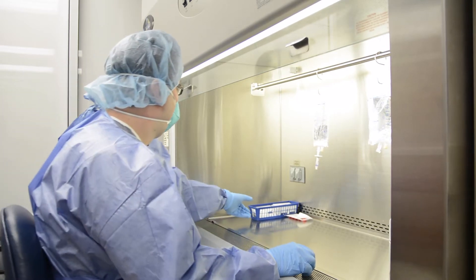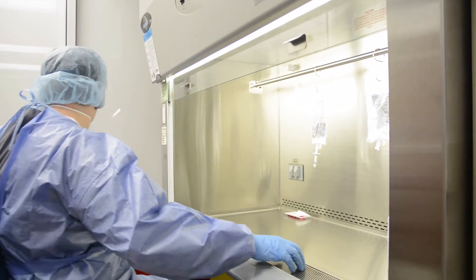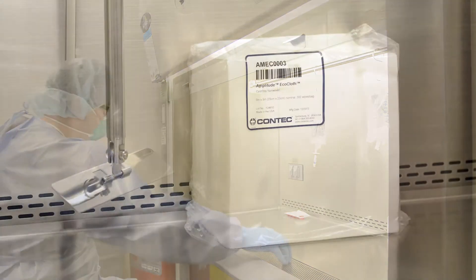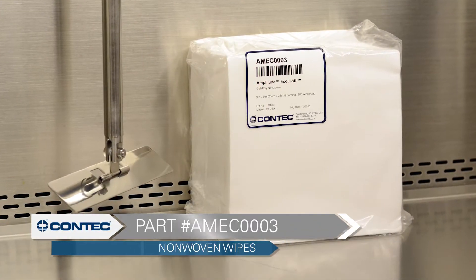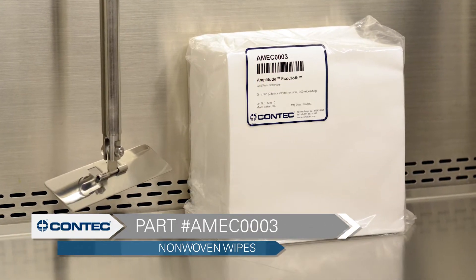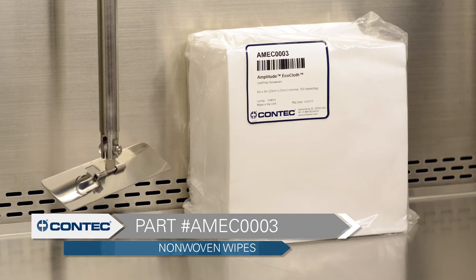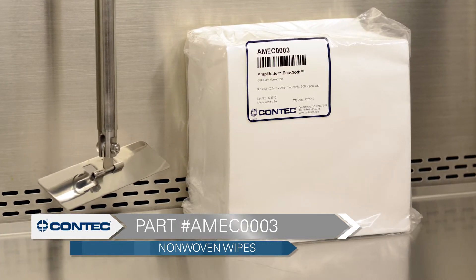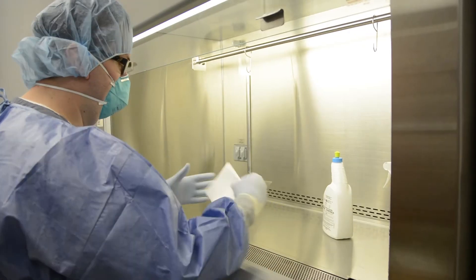Before you start cleaning, remove all loose items from the hood. Unlike cotton gauze, which sheds a lot of fibers and particles, spun-laced nonwoven wipes are much cleaner and are much more suitable for critical environments like chemotherapy preparation areas.